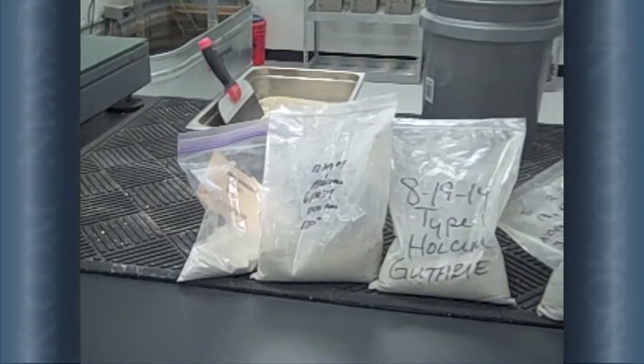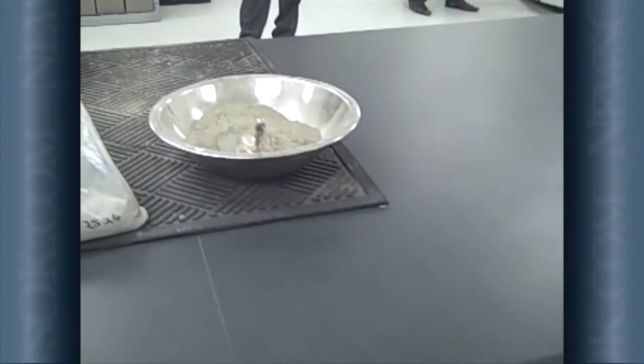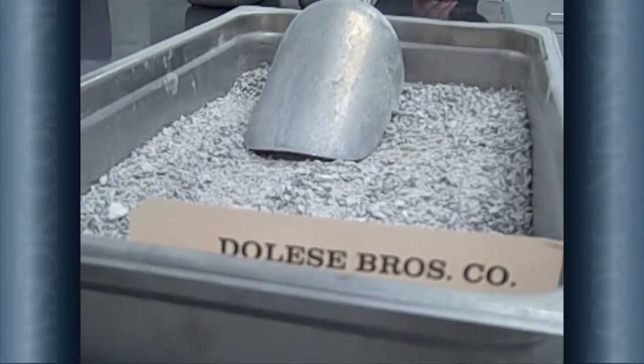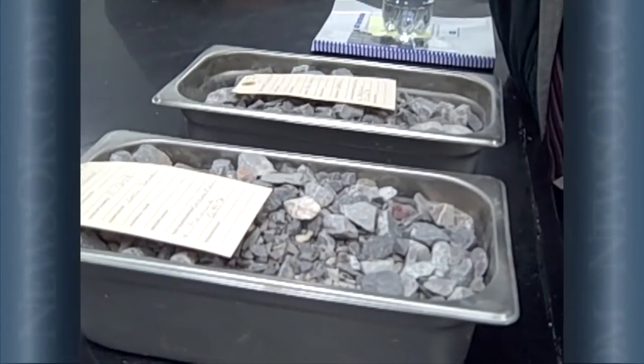What we do in this side of the lab is we do all the testing on the cements and the fly ash. The cement is basically what glues everything together. And we bring in all the aggregates, the rock, the sand, all of that, and that's the bulk of the concrete. But what glues everything together and makes it nice and tight and hard is that cement that we test around here. So all this equipment that you see around here is to test the cement.